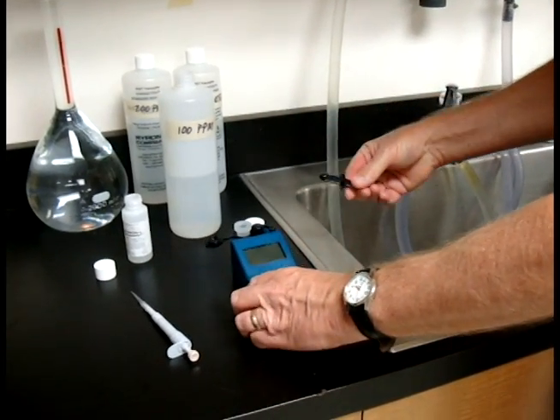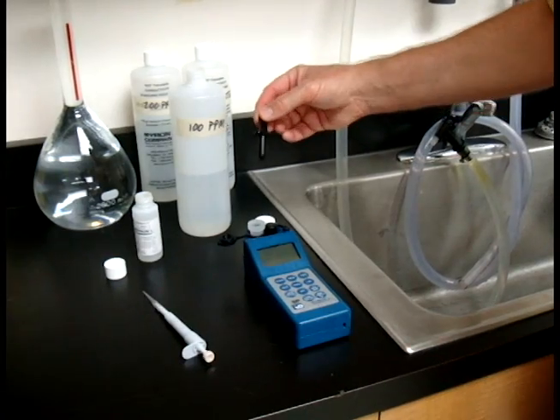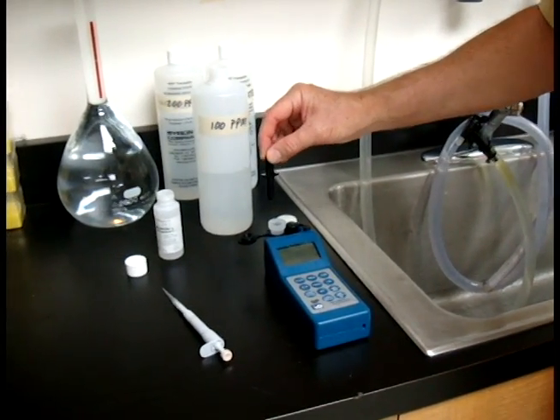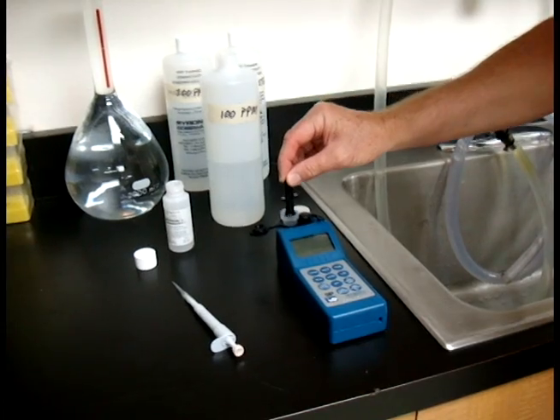Make sure that your T-plunger is clean. We're going to dissipate all the solution that we don't need. And to do that, you simply just put it in. Again, don't jab it in, but put it in.